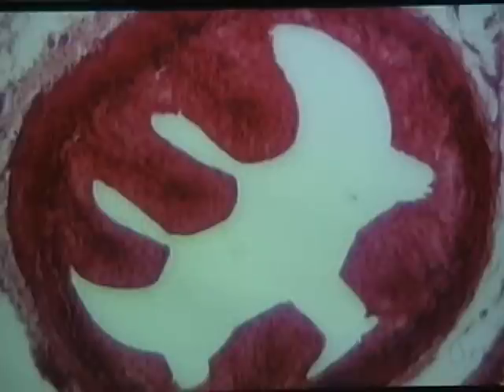If we increase the magnification, we'll get a little better sense of the nature of the transitional epithelial tissue. When the ureter or the urinary bladder, and those are the two locations of transitional epithelial tissue, are empty, the tissue is sort of oval, sort of egg-shaped. On the other hand, when the urinary bladder is filled with urine and it stretches, the tissue stretches out, and so the cells go from almost cuboidal, but more of an oval or egg shape, to very, very flat, very squamous looking.